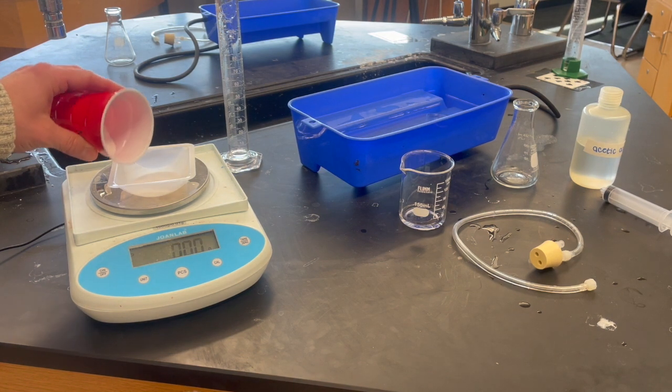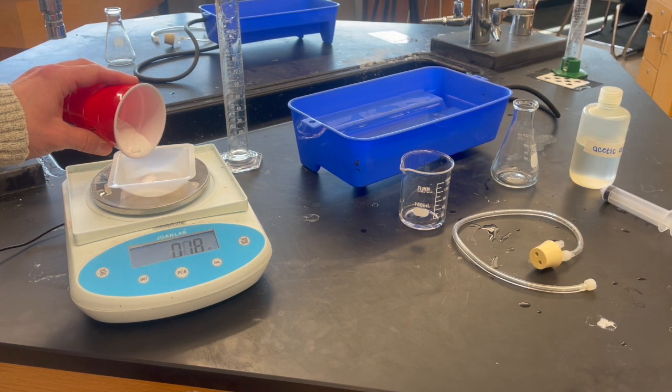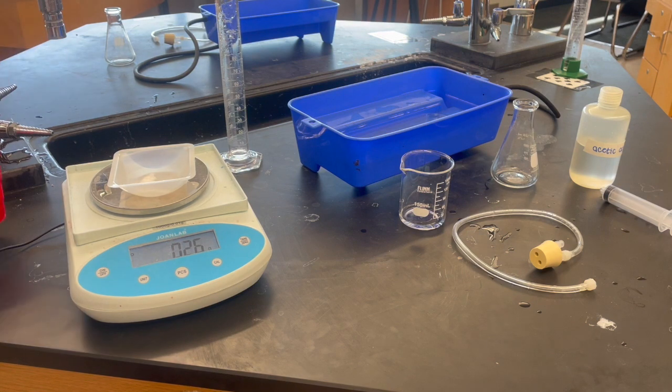Hey everybody, welcome back into the lab. Today we're going to measure out the 0.25 grams of baking soda that we calculated in our pre-lab number one.